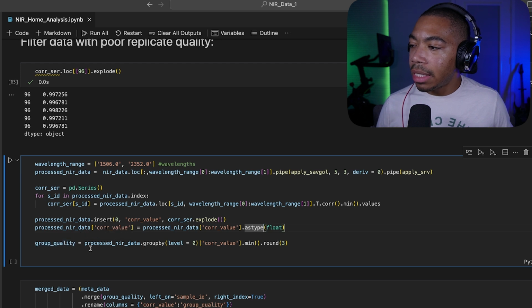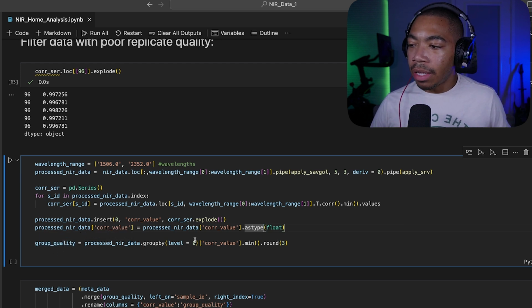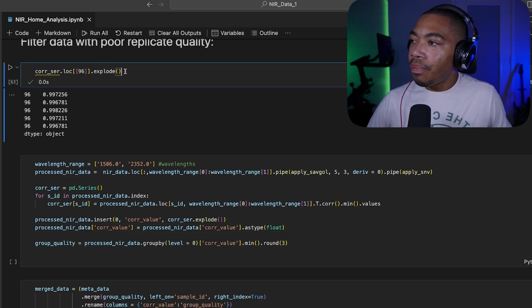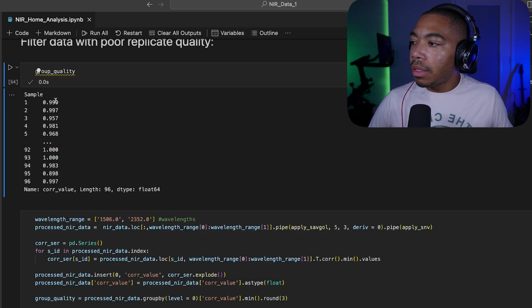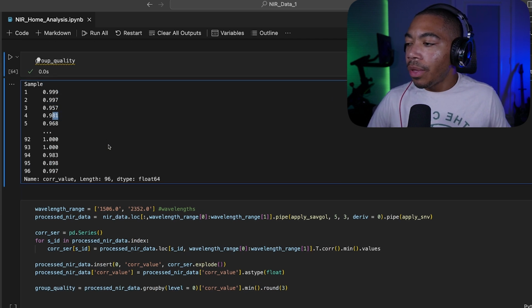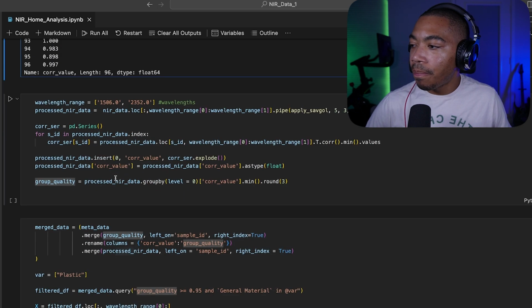And then lastly, in the cell, we're going to look at the group quality by grouping by the index values and returning the minimum correlation value, so that we have a new series called group quality. And we're just going to look at the worst replicate in each of these. And then we'll add this to our larger data table that I'll show you in the next cell.